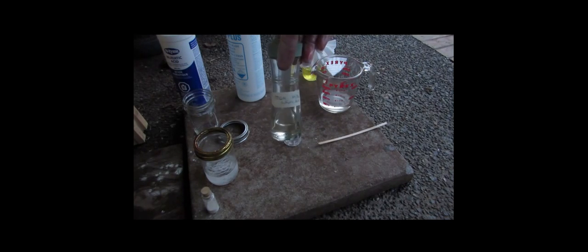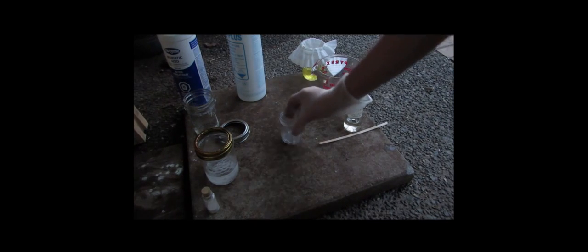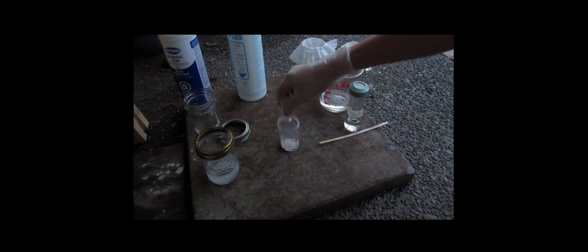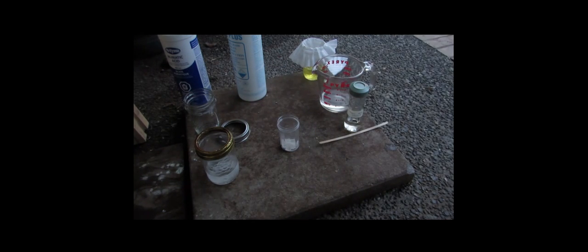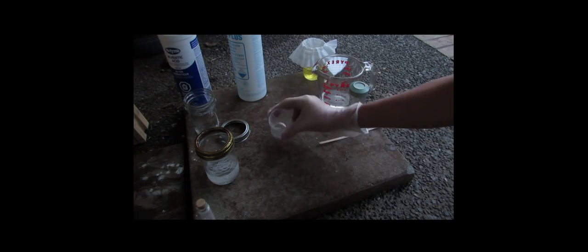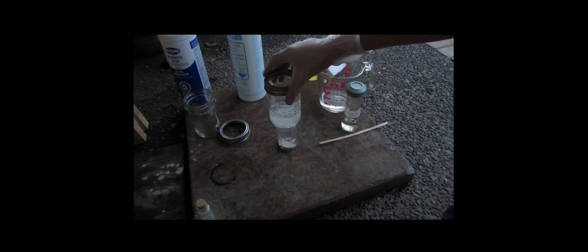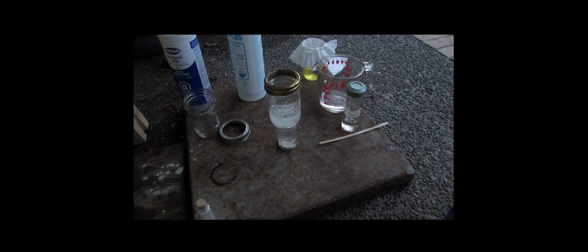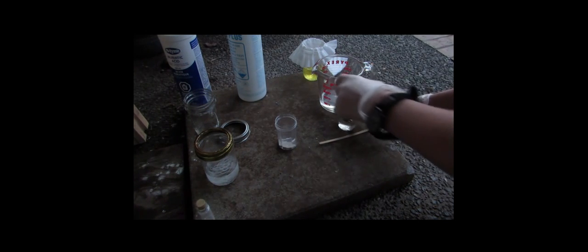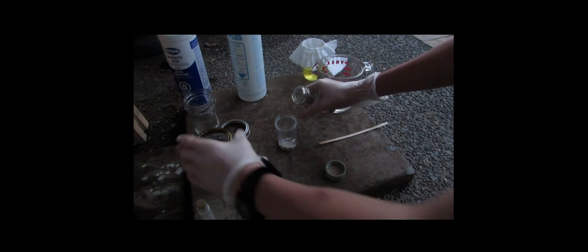But we're going to try the rest with some sulfuric acid. Now this here is that 70% sulfuric acid, which we made in a separate video. We're going to be attempting to use this for iodine. So in a small container, we're going to add the rest of our potassium iodide. Now hopefully this is going to work. This is my last chance, or else I'll have to go get some more kelp and redo the whole process. And then we're going to add a bit of this sulfuric acid, and then stick this bath of ice along with salt and water, which is super cold.